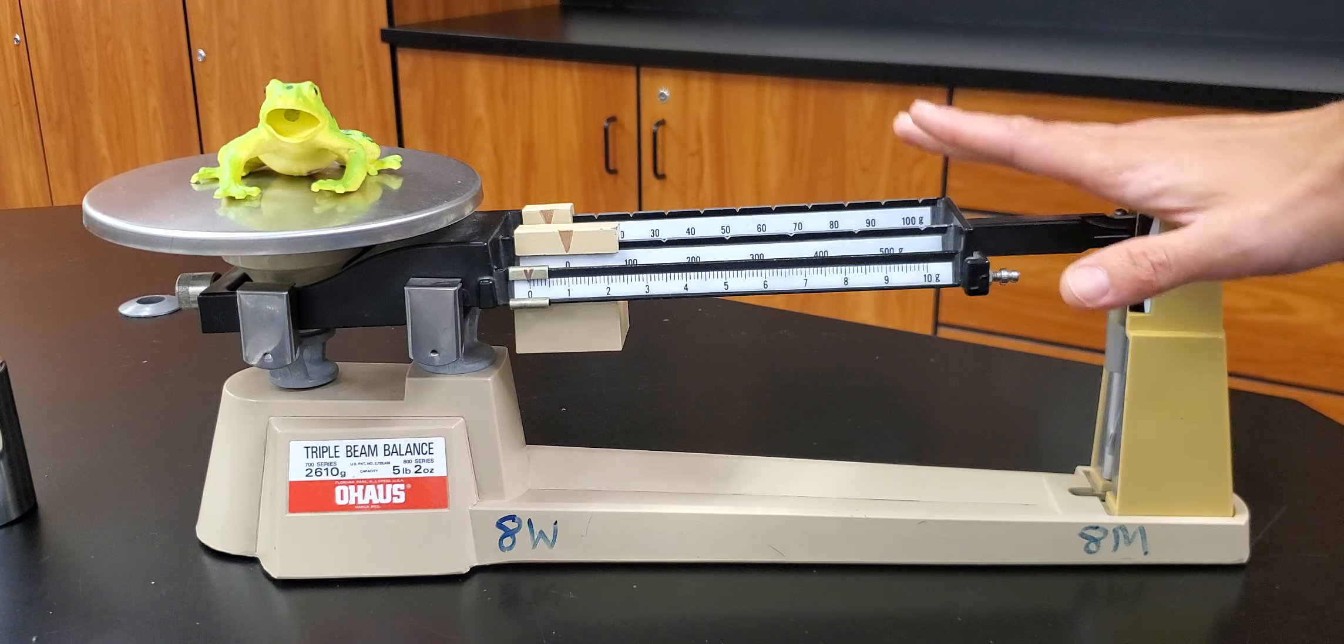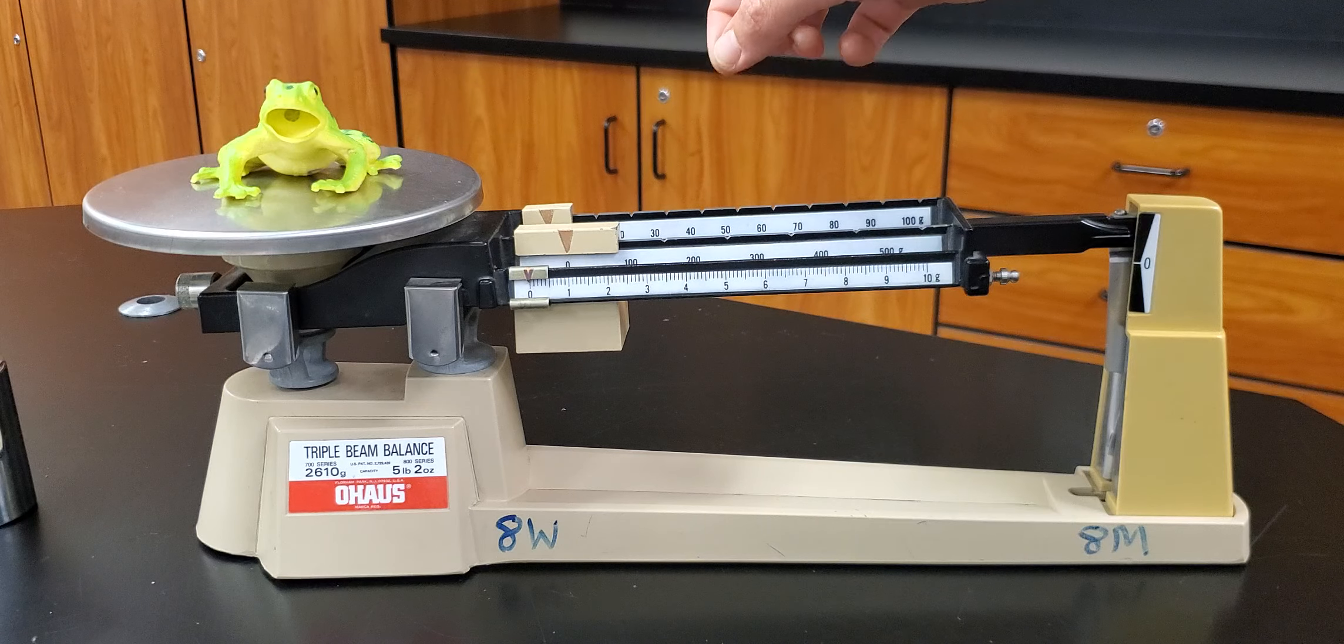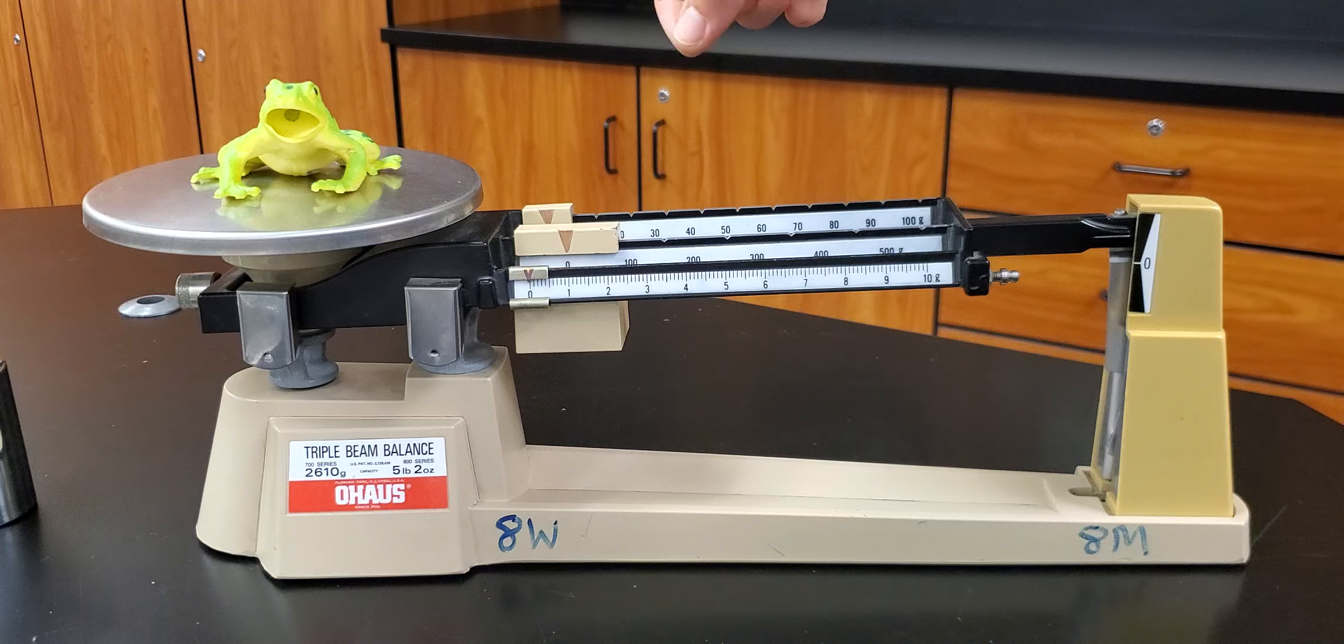So the way we use a triple beam balance, it's important that we move the weights in the correct sequence and with the right technique.